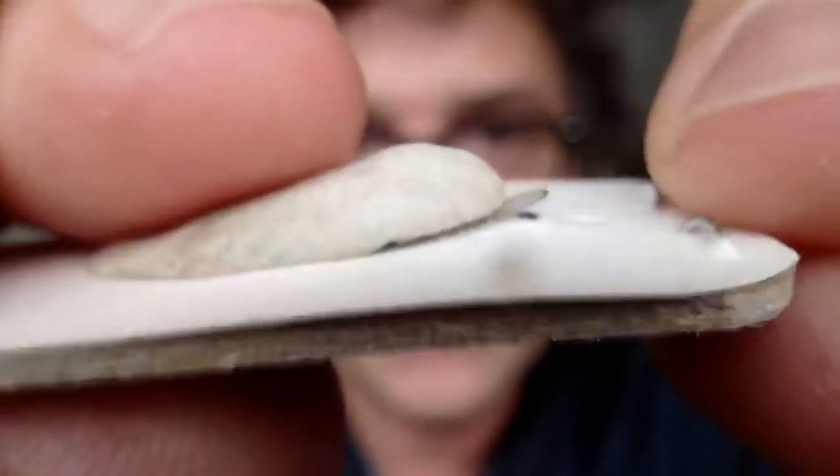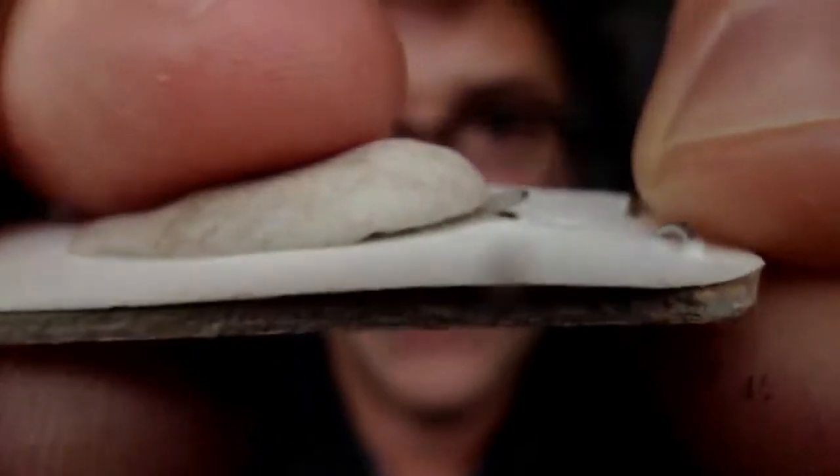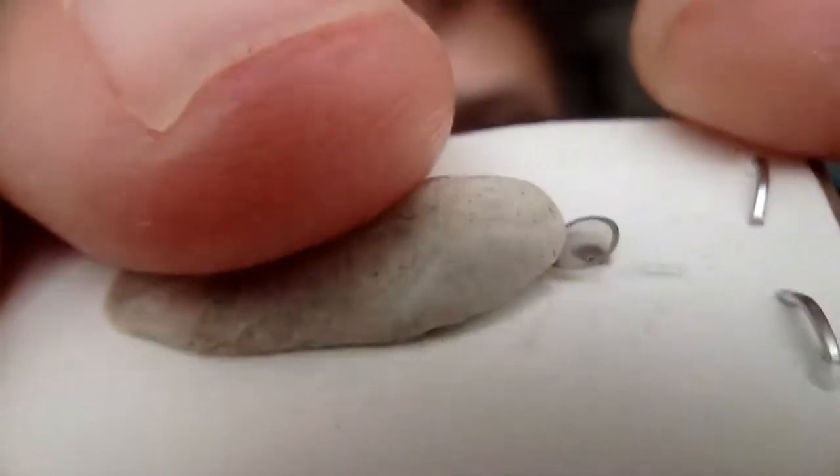So the last step is how you mount specimens and focus, and that is actually a neat trick with Elmer's sticky tack that you used to put up posters. So you see, this is the sticky tack here, and I've mounted, in this case, you can see there's an EM grid.